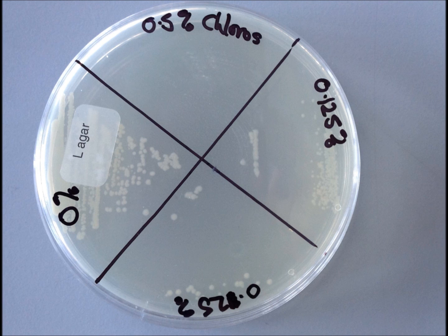But if I take a loop from the 0.5% solution and streak it onto the agar plate you can see that there's no growth. So we know that 0.5% Chloros is not only bacteriostatic but it's also bactericidal.